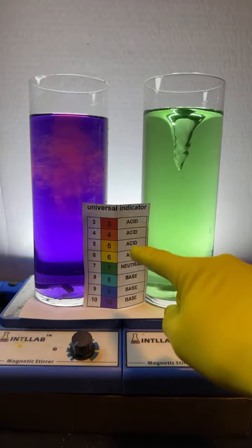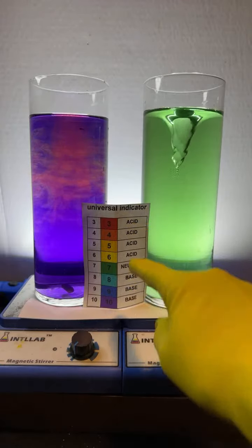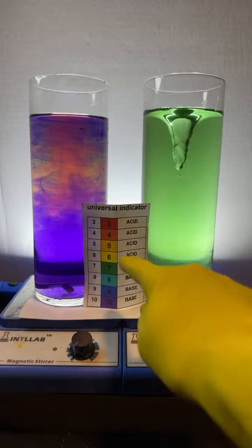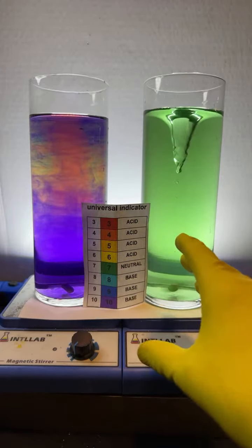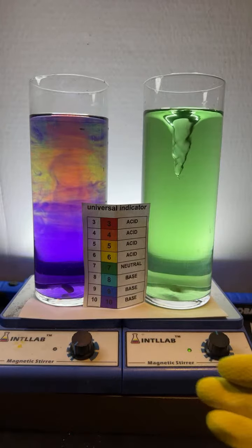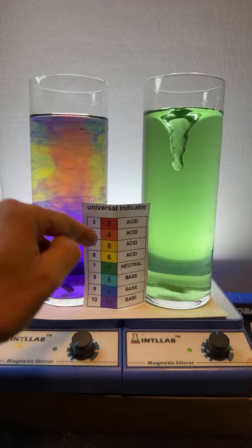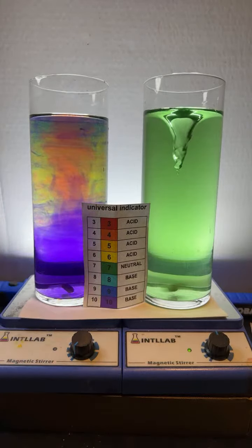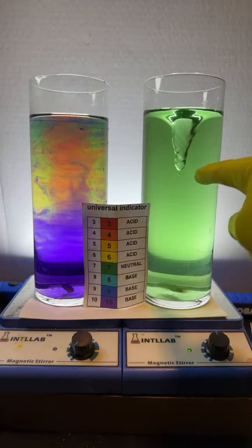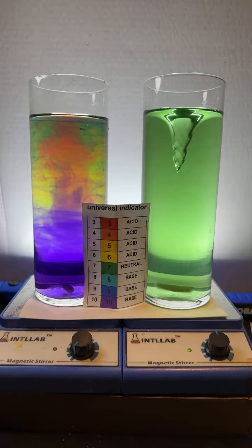So if you look here, you can see the different colors that will be displayed. What happens after red, Henry? It just stays red. So you see the different colors that will be displayed at the different pH values. pH is a way that chemists talk about how acidic or basic something is. The lower the pH, the more acidic it is. The higher the pH, the more alkaline it is, the less acidic it is. Over here, this one's neutral, pH 7. It's neither acidic nor basic.